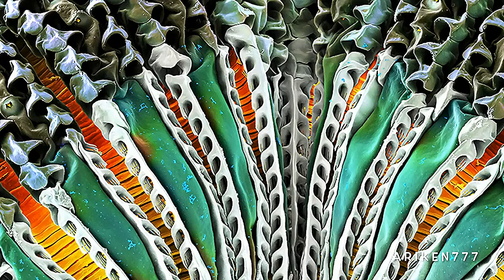The tip of a fly proboscis. Fruit flies possess mouth parts adapted for sucking and feed on plant juices. The tip of the proboscis has spongy structures and conveys liquid food to the mouth. Solid foods are dissolved in a drop of saliva and sucked up in the same way.